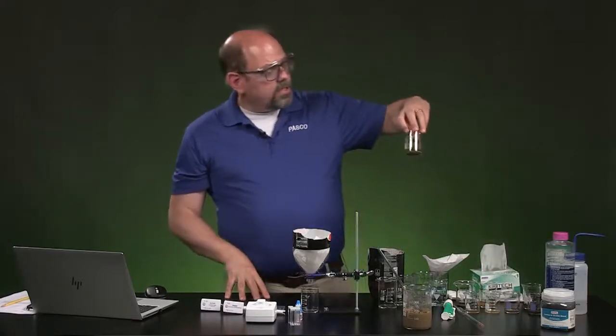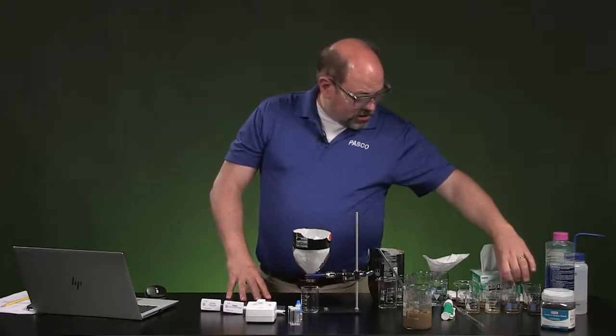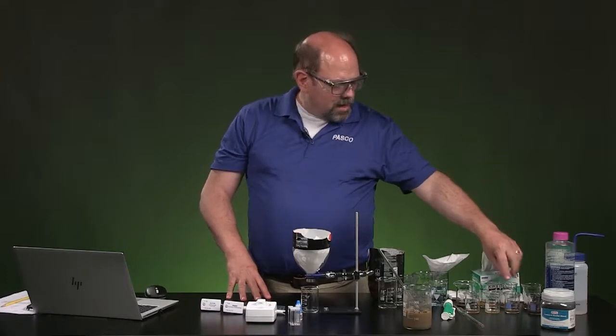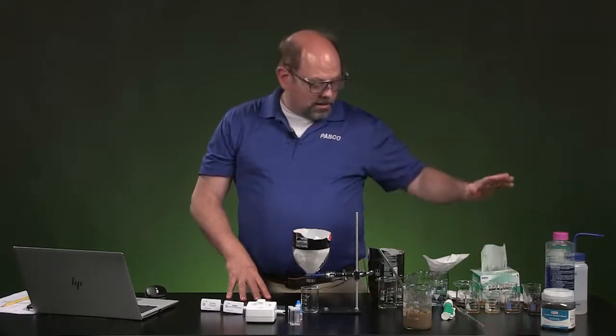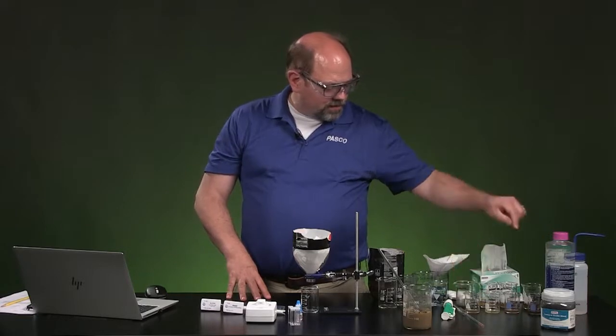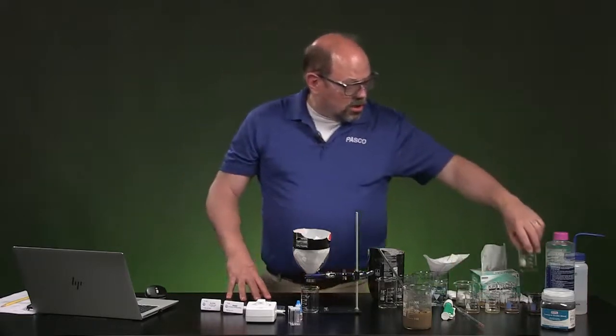All right, our third attempt, we're going to take a look at just to see what happens if we let this sit. I poured these in here so we save some time. I put this in about an hour ago, and I let it sit a little longer than just the unfiltered one, which we're just going to stir and pour through our filter and see if that makes a difference. The very last one we're going to take a look at uses a charcoal filter.